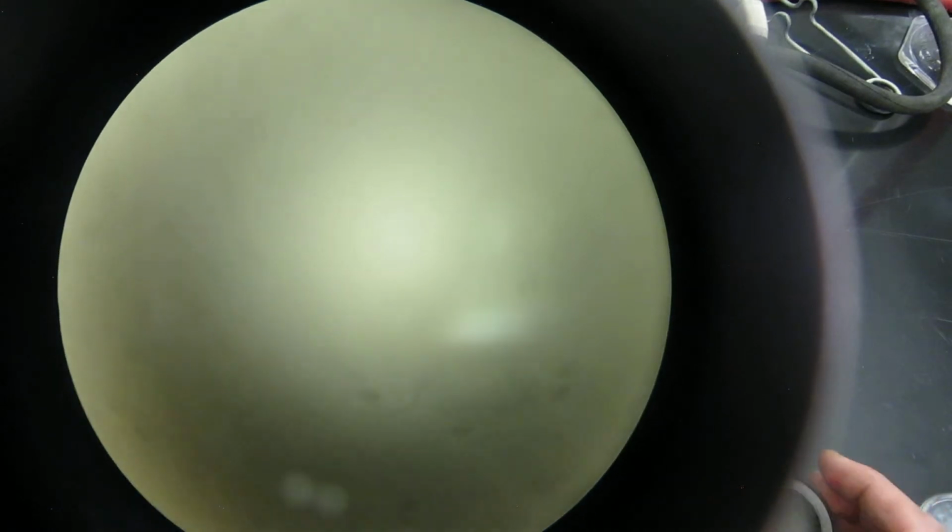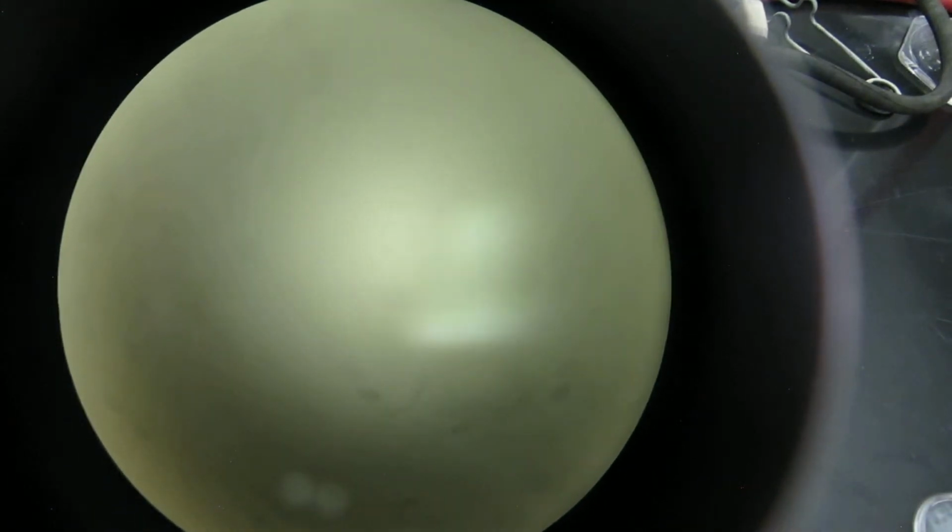Now let me show you the 0 dilution one, which is also from there, and you'll see a lot more colonies growing here. Now you can't really count these because it's confluent growth, total confluent growth. They're all grown together. Another reason you do dilutions with this stormwater is that it has a lot of sediment in it. So when the sediment is there on the filter, the sediment will kind of disturb the growth of the actual bacteria.